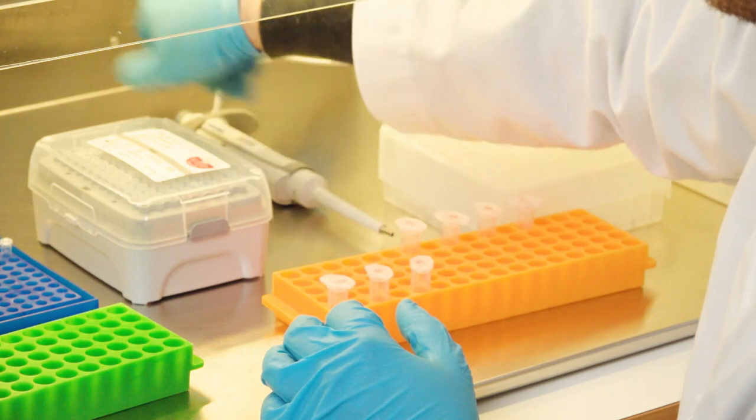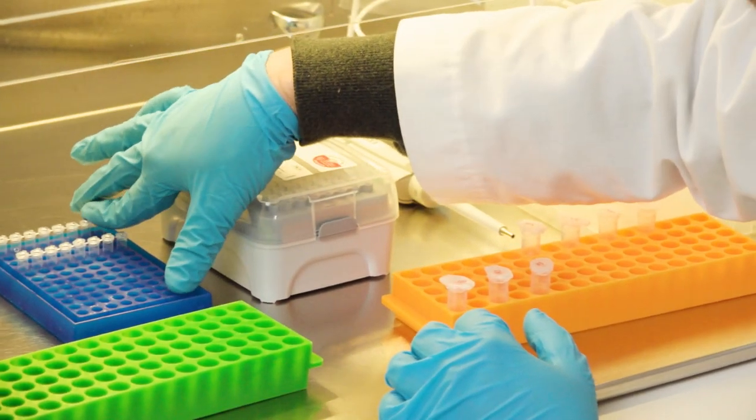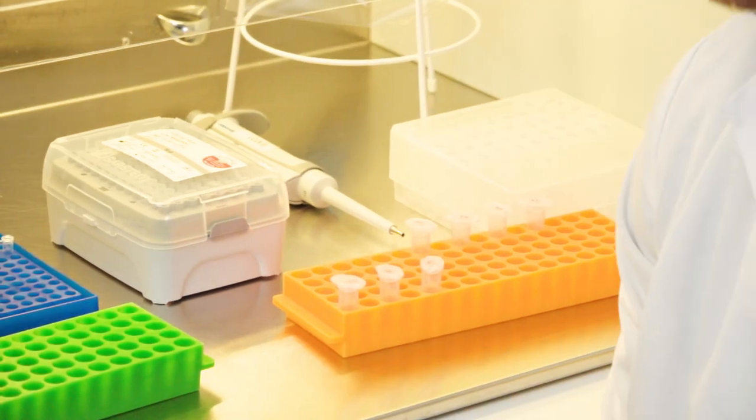After you're done, it's very important that you close everything. Put the samples back into the freezer.